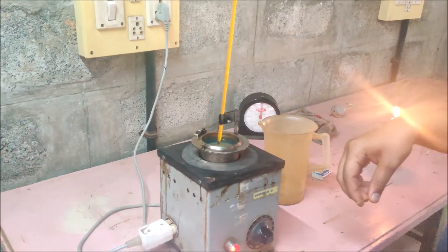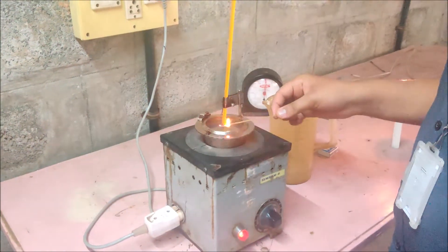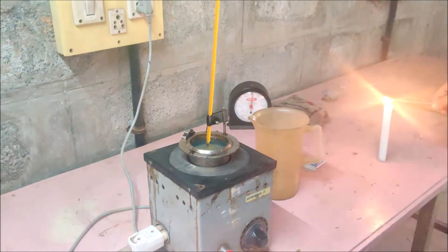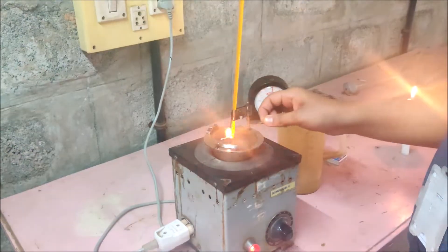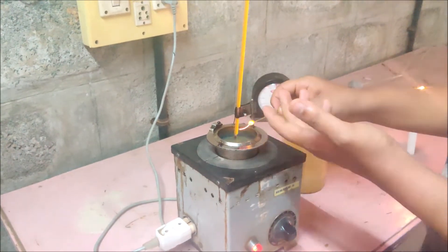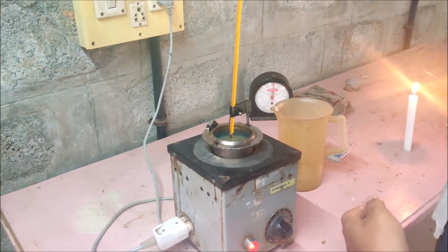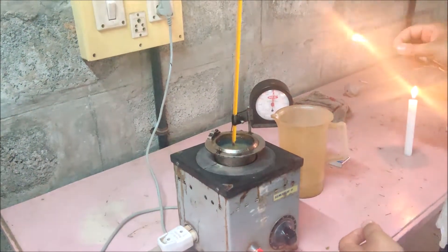You have to be entering the readings in your tabular column. The flame should be reintroduced at regular intervals. As the oil heats, the vapors of the oil catch fire. At one point there will be a flash, so you have to keep reintroducing the flame until you get the flash point.